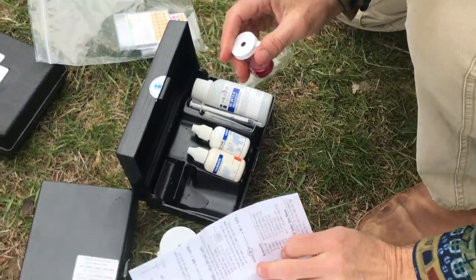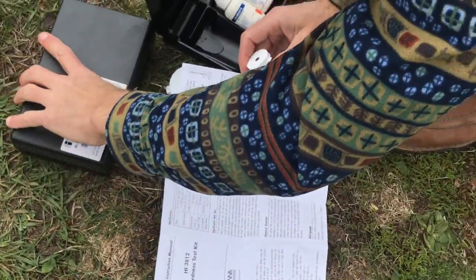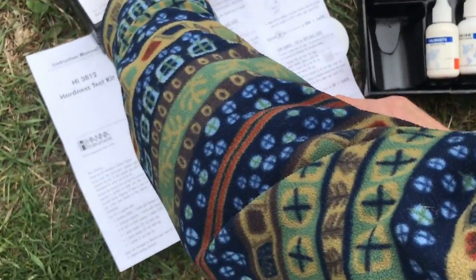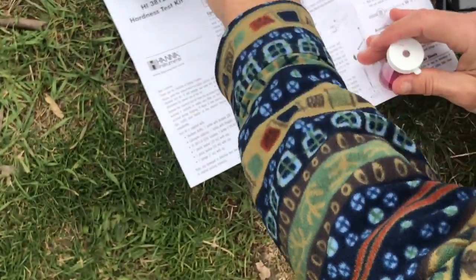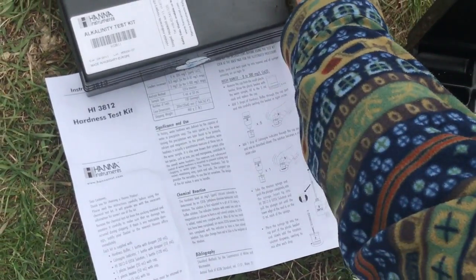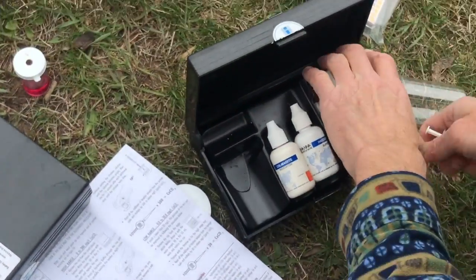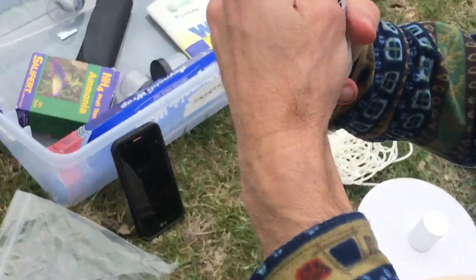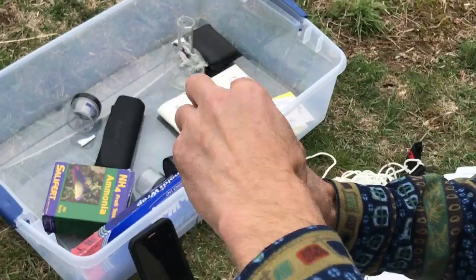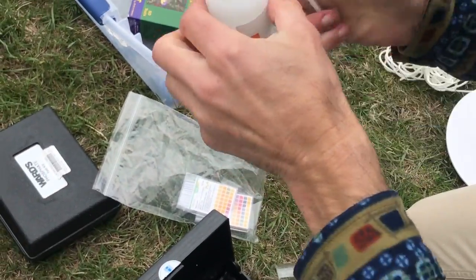And we are going to now, again, run a titration. And we're going to titrate until it turns to a purple and then a blue. Okay, so this is a little bit trickier. Catching it exactly when it turns. You saw how fast it turned last time. It's going to maybe turn even faster this time, okay, with our hardness test.